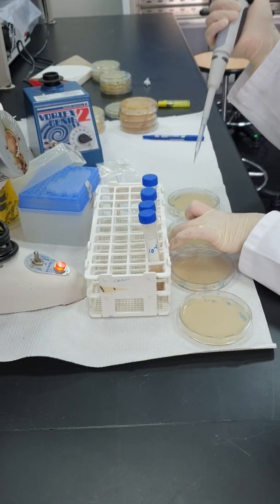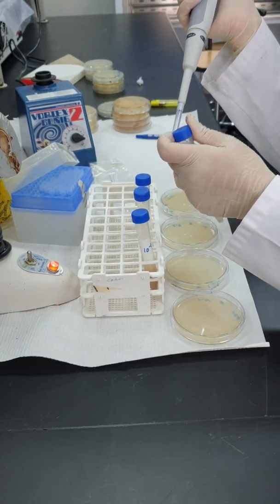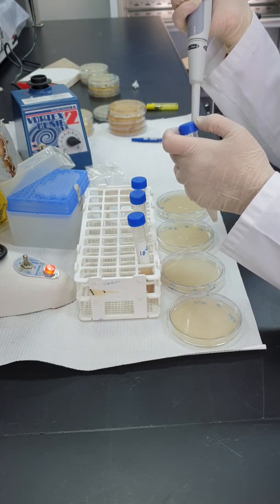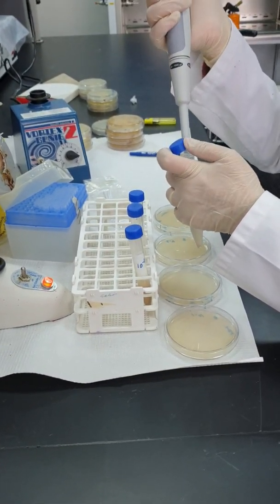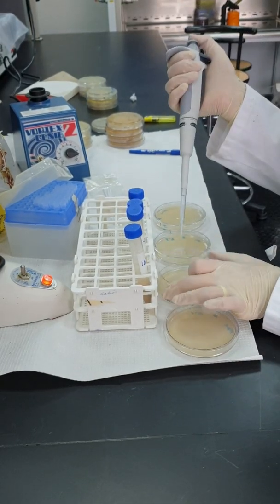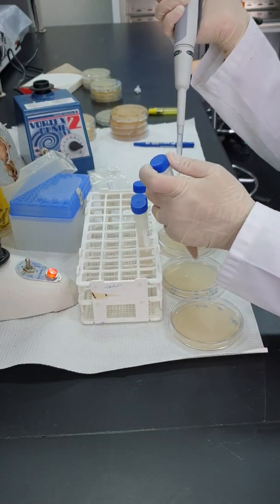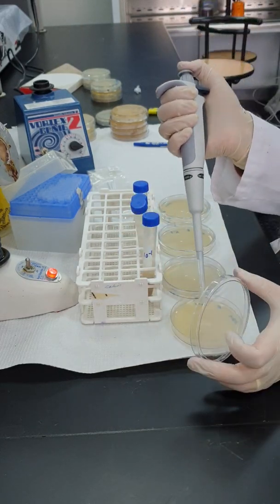When you are pipetting, feel the tip of the pipette when you press. There are 2 stops of your pressing. You can press gently or you can overpress. When you fill, press gently, suck the liquid, and when you empty, overpress. So if you overpress and you suck, you will take much more than the number written. So press gently, empty the air, take the amount of liquid necessary, and then overpress to empty.